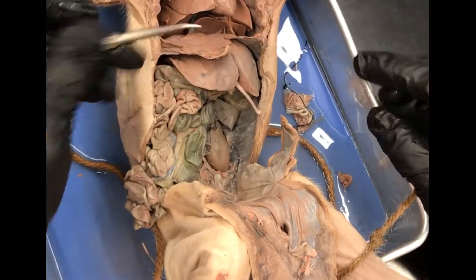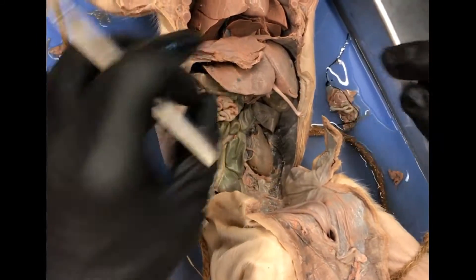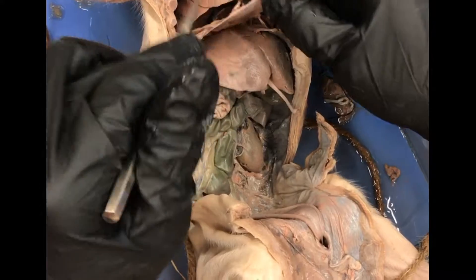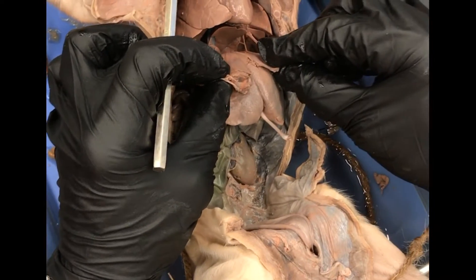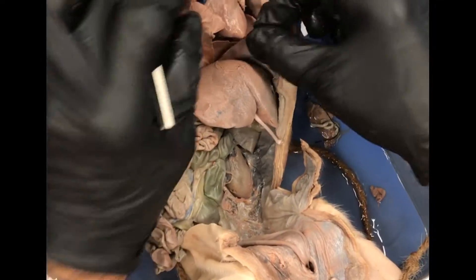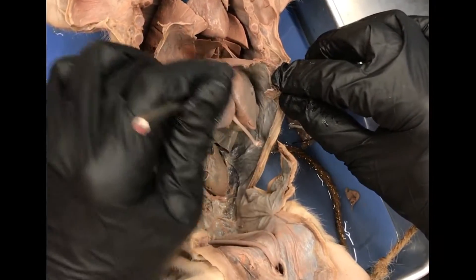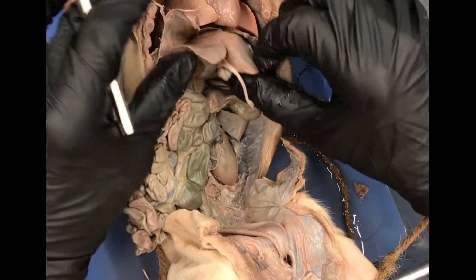Alright, so we're starting with the abdominal cavity. This is the diaphragm — this big broad muscle here is the diaphragm. And then this large organ here, of course, is the liver.